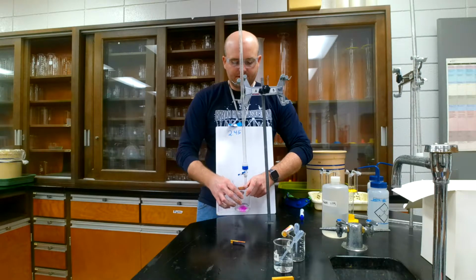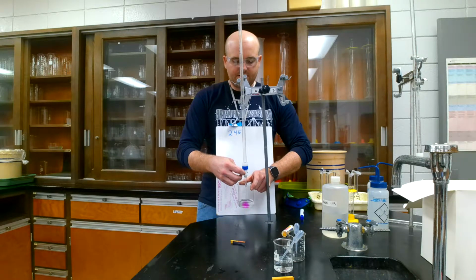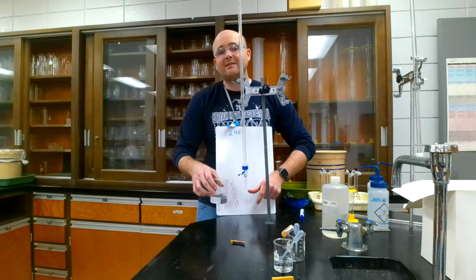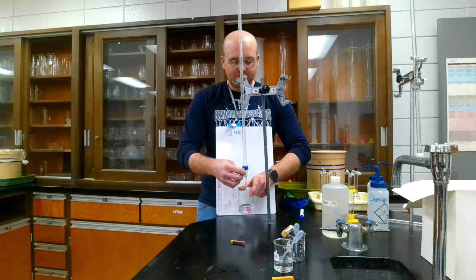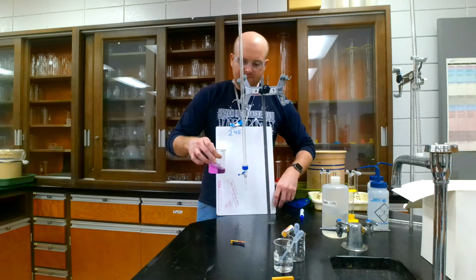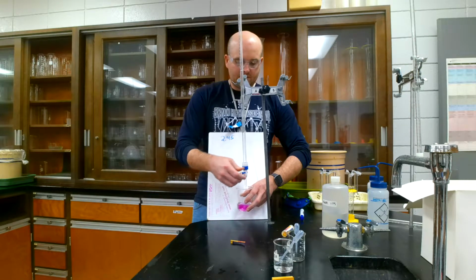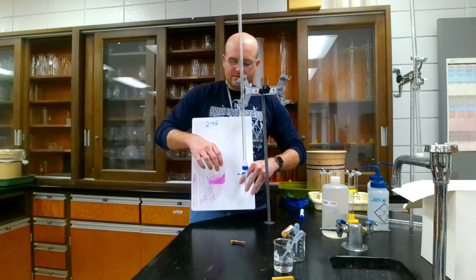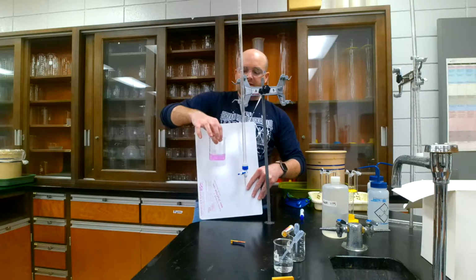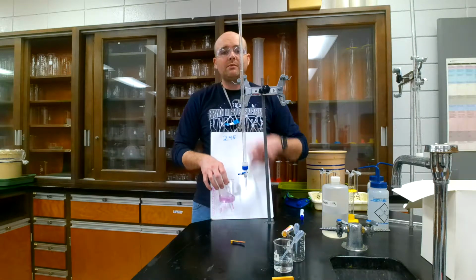You have to be careful with these things because you'll creep up to it, and all of a sudden you'll hit that point, and it will instantly change colors all at once, and you won't be able to change it back. So you have to be careful. You want to creep up gently. This is very light pink. And there we go. So we are right at that point where it's very light pink. That is right where we want to be. So that would be the end point, the point at which it changes color.